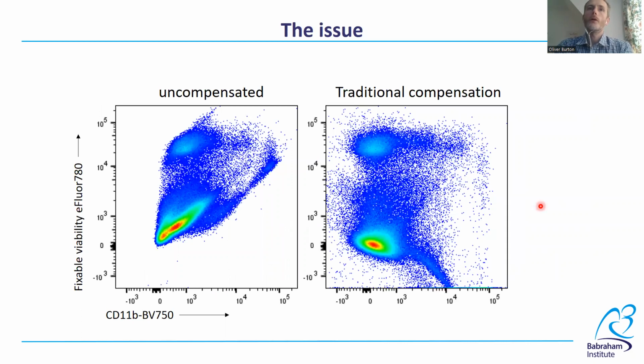About 5 years ago, we first started using the BD FACSymphony, setting up panels with over 25 colors. We quickly ran into issues with the compensation. Here's a typical example of what we experienced, showing the uncompensated data here on the left, and the data compensated using single stain cells on the right, using the traditional positive-negative population method.